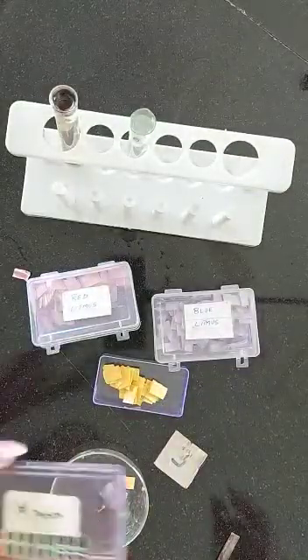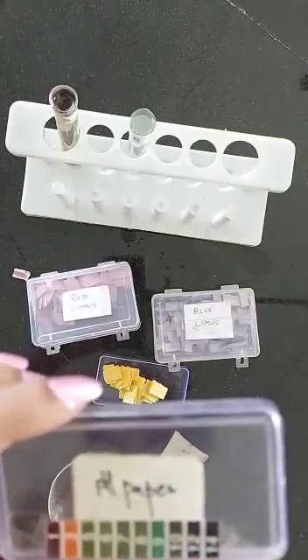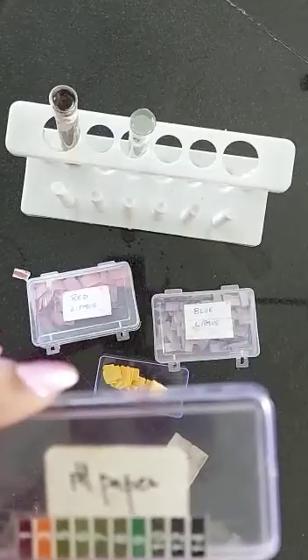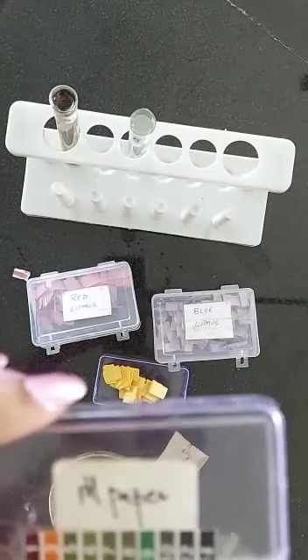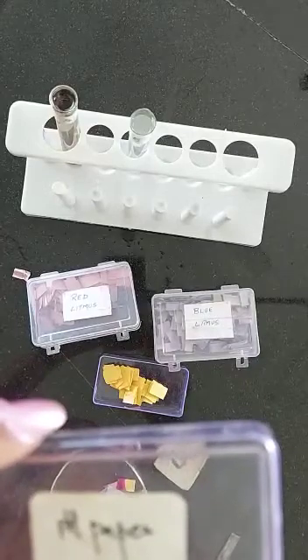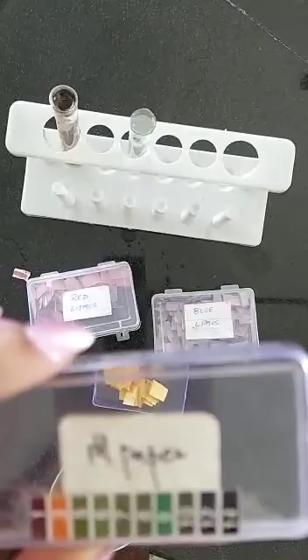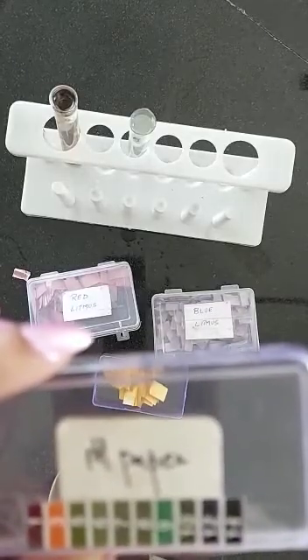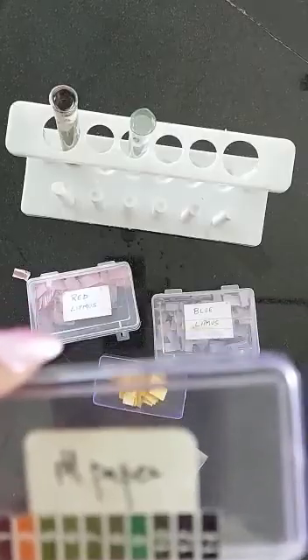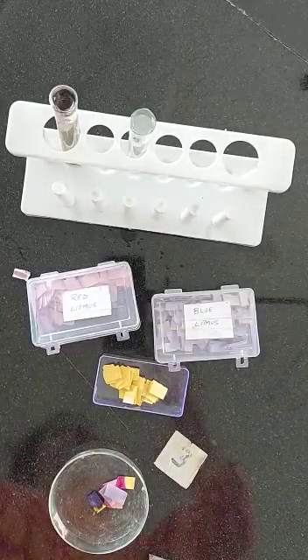One thing you must remember about the pH scale: the pH scale is from 1 to 14, where 7 is neutral — water is pH 7, it's neutral — 1 to 7 is acidic and 8 to 14 is basic. So remember: on the pH scale, 1 to 7 is acidic and 8 to 14 is basic. I do hope you've understood this experiment. Thank you, children.